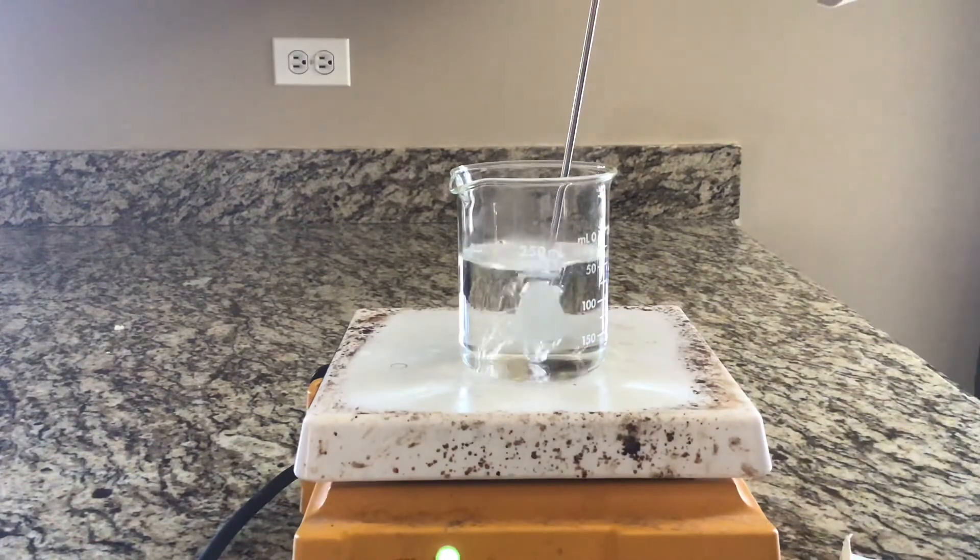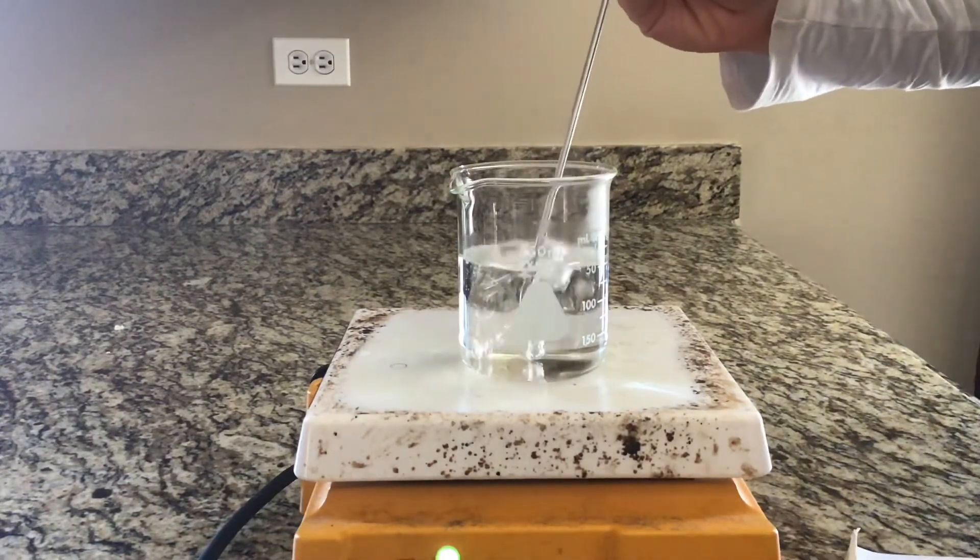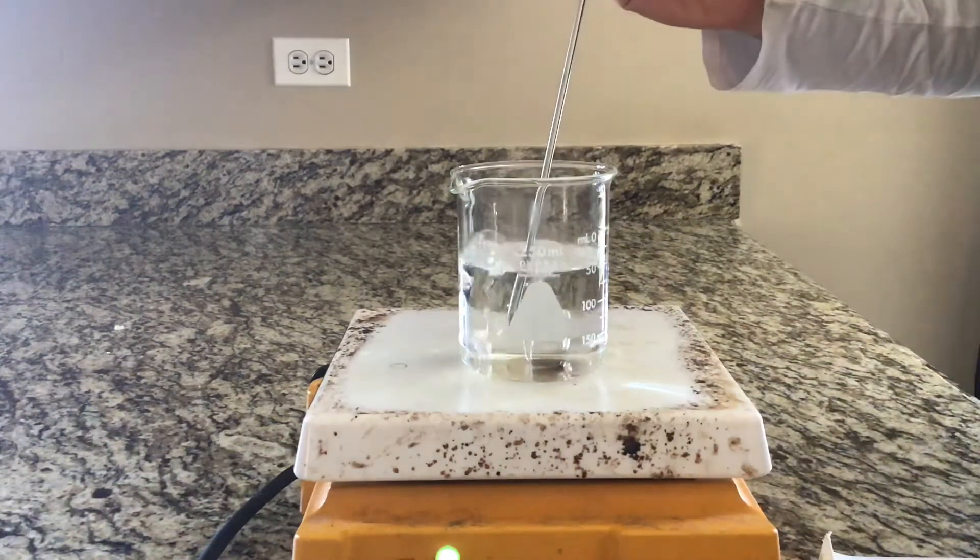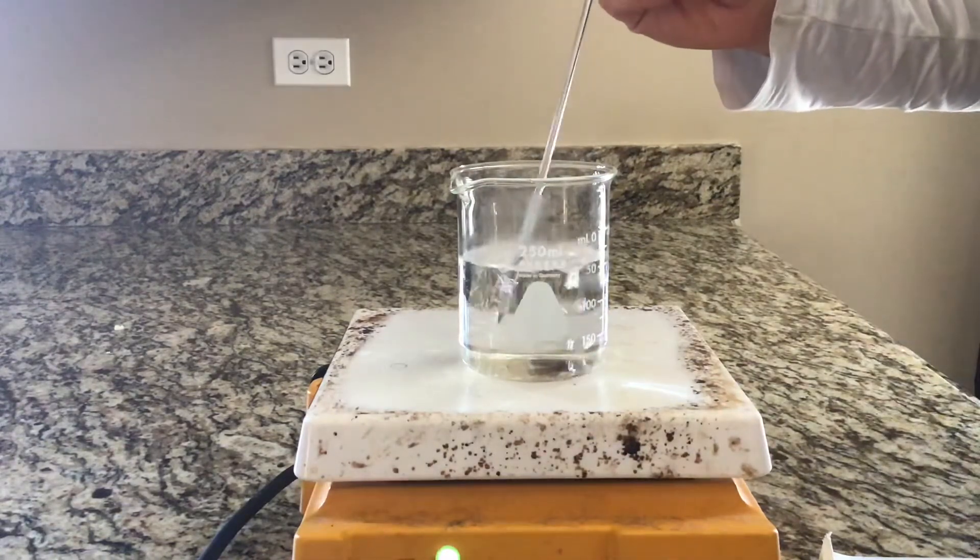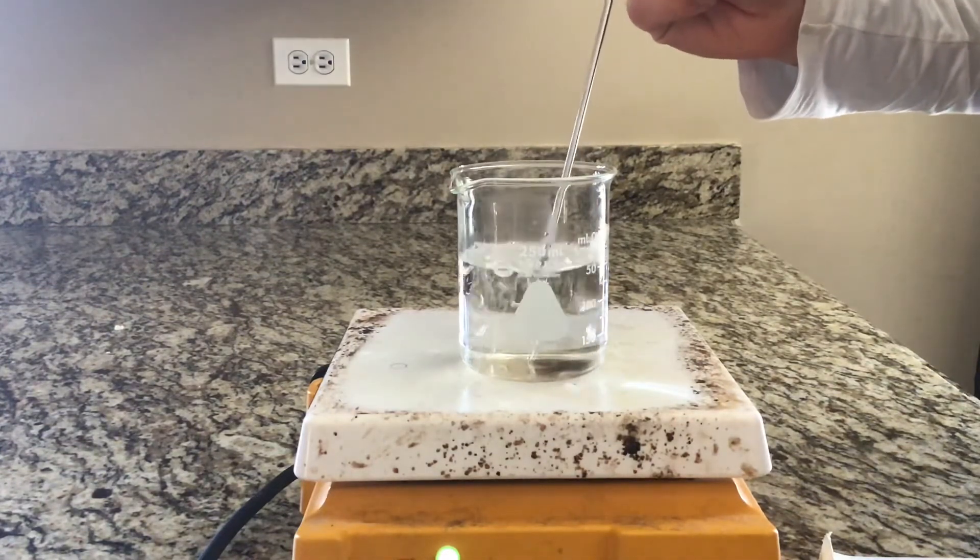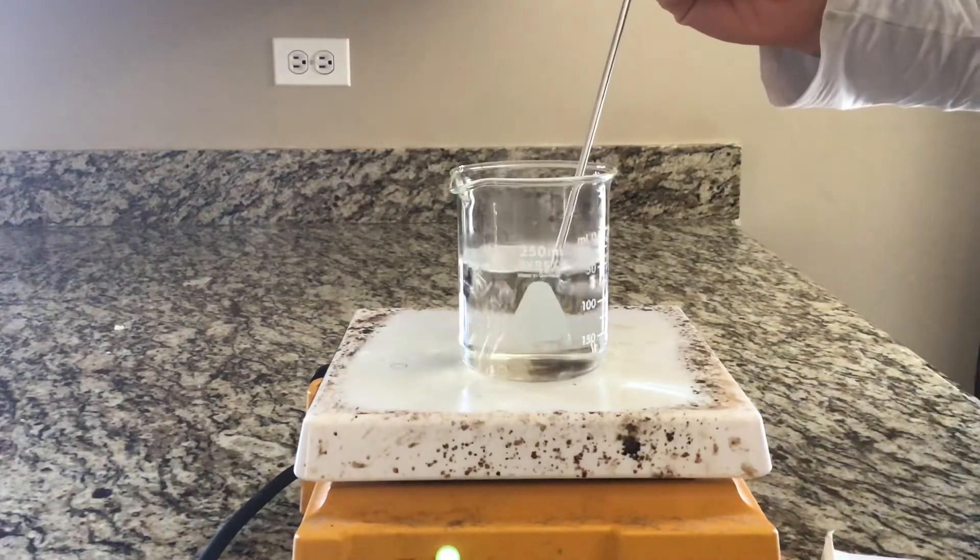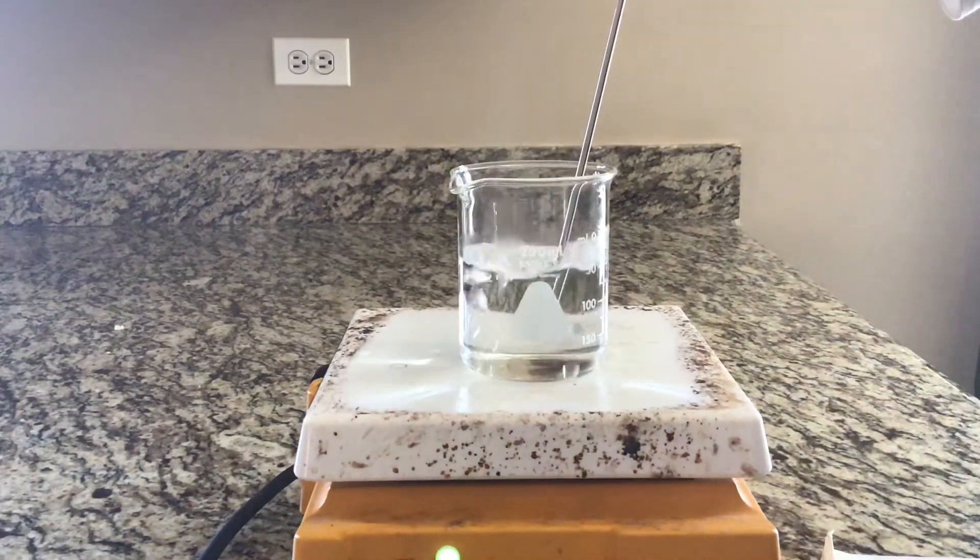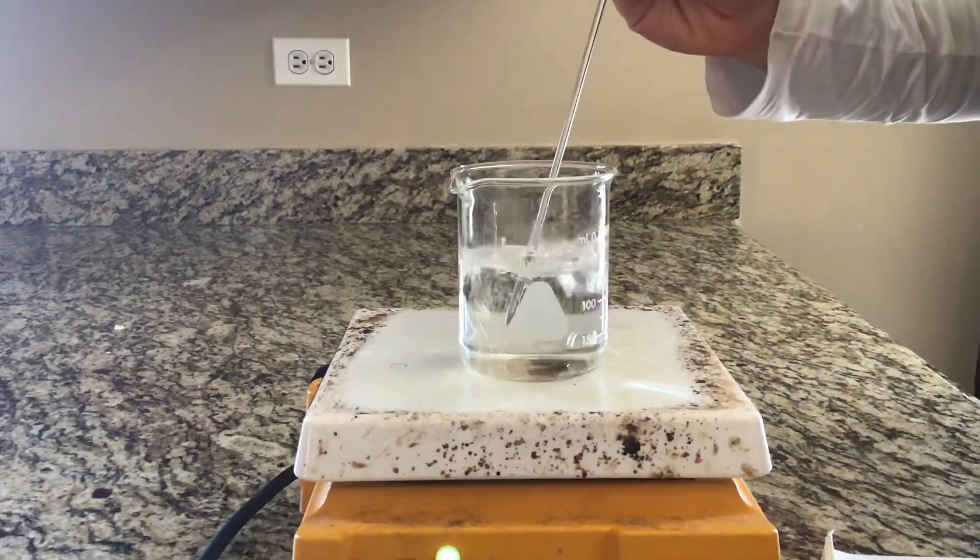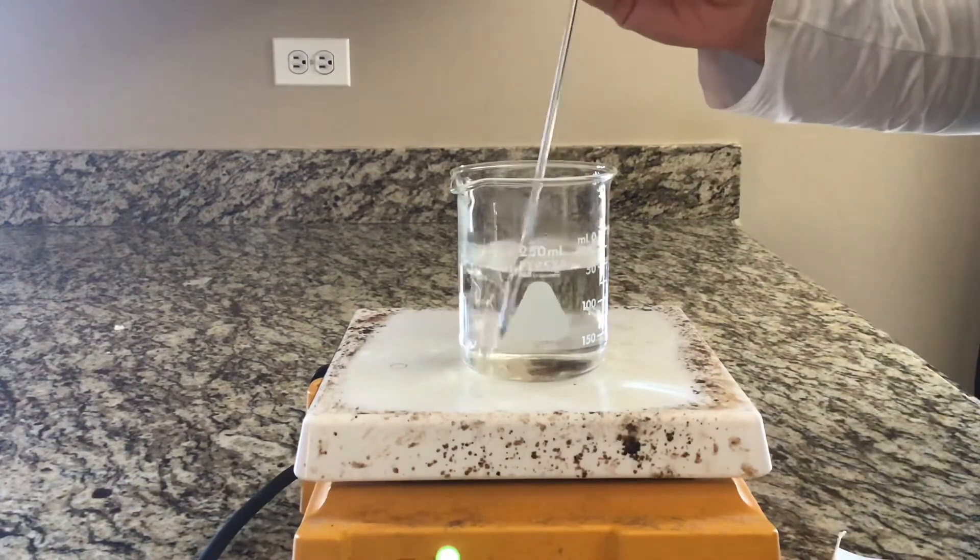I think it's safe to say this is boiling at 14 minutes on the dot, and the temperature right now is 99.5. Now we're going to continue to watch this for another 120 seconds. Why? Because we want to see if the temperature is going to change while it is boiling. Here we go, our next reading, another 20 seconds, is going to be at 100 degrees exactly, 100 degrees Celsius. By the way, at 100 degrees Celsius, let's circle that temperature. That's when we know it was boiling.